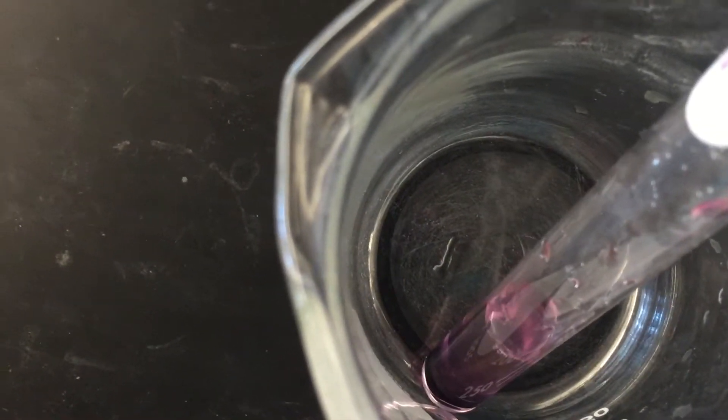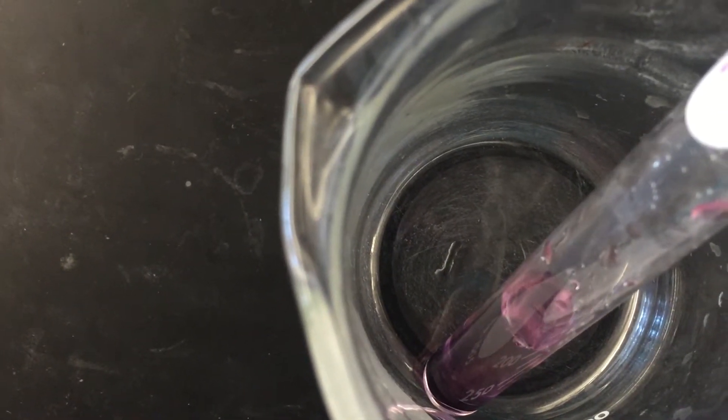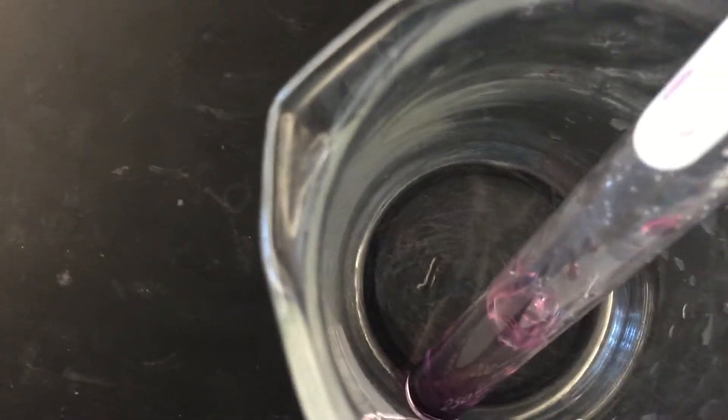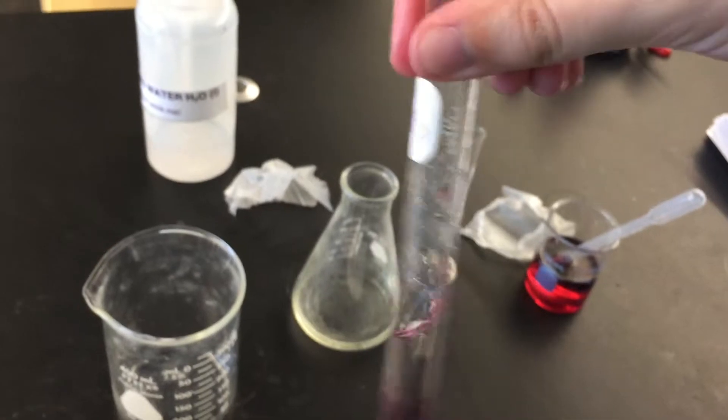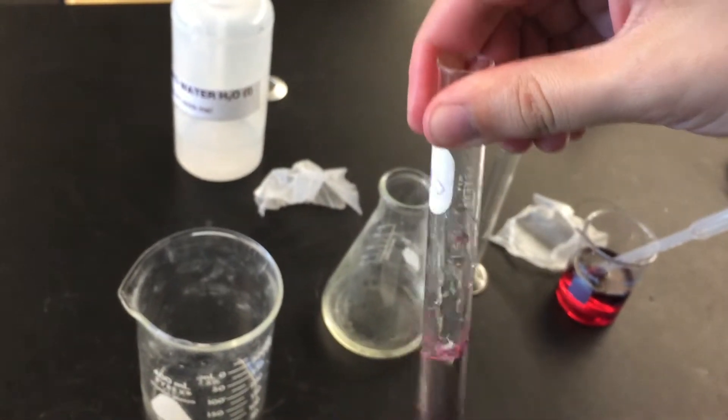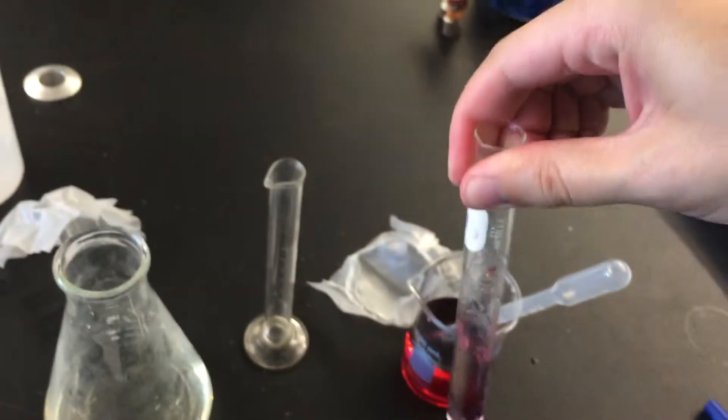Here is when we add distilled water. You can probably already see it turning a little bit more pink. I need to mix this around a bit. Mix it around.